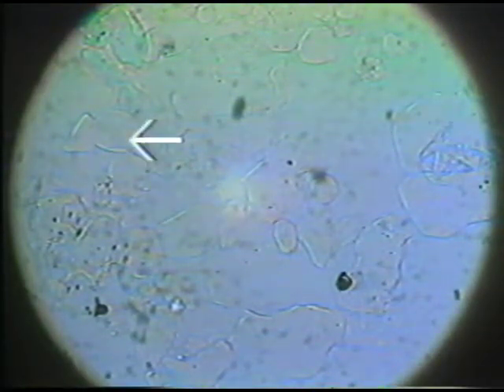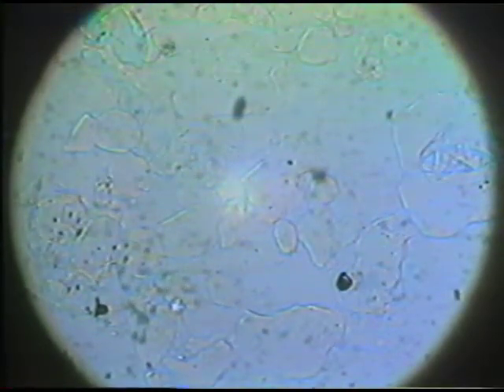And as I raise the plane of focus, you may be able to discern very slight colored Becke lines which are observed in this particular mineral grain. That is, we're beginning to see very slightly colored Becke lines in this particular mount. And so the combination of having very, very small boundary effects and having colored Becke lines should lead you to apply the oblique illumination test. And so I'm going to do this.